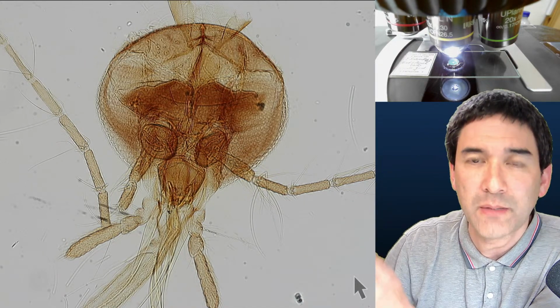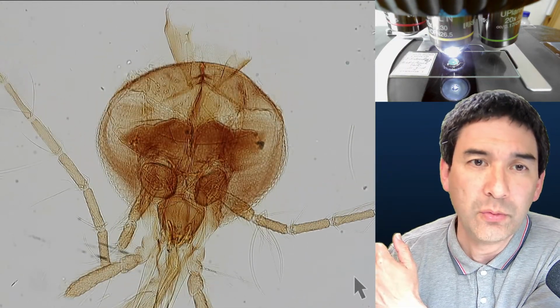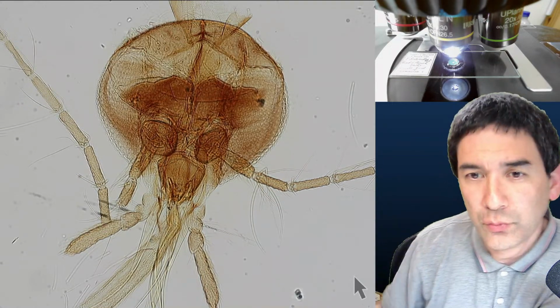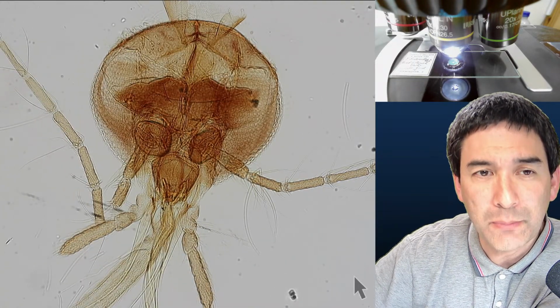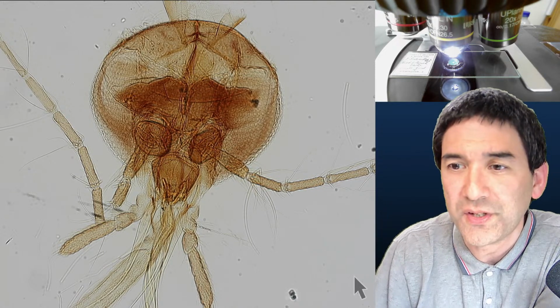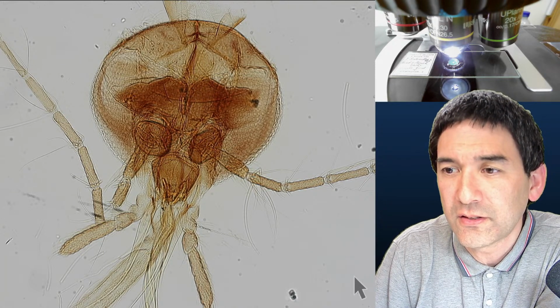Maybe to add some kind of a motor to when I do live streams like this. I have to reach over now to the microscope, but it would be kind of nice to also have some kind of a system in place where I can maybe control the whole thing with a joystick.